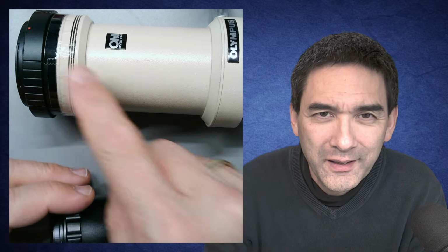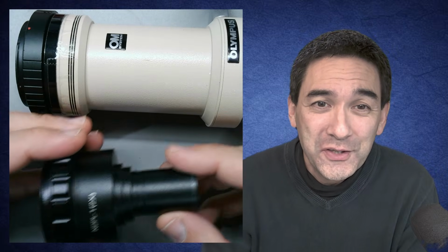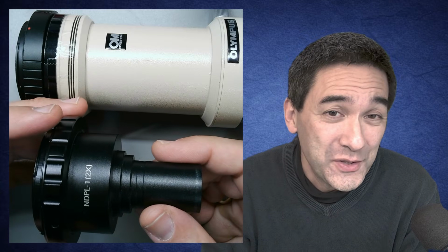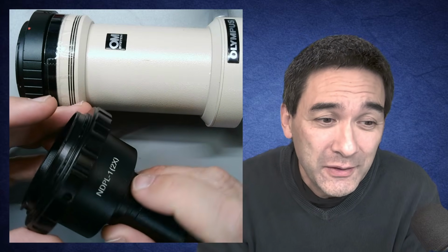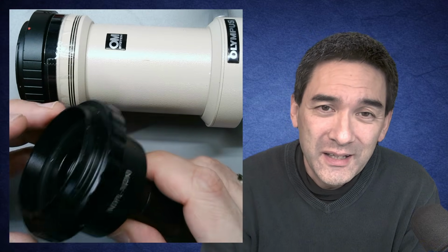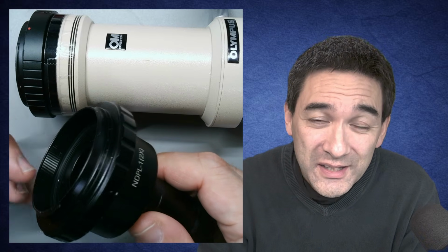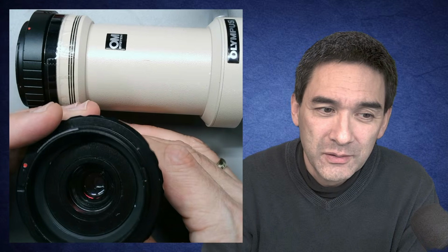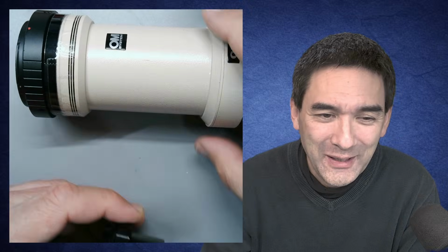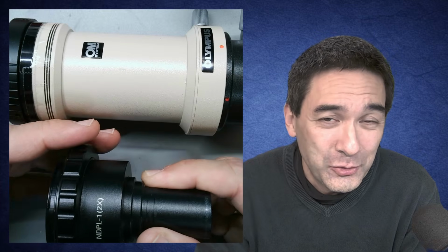Now, if you think that this adapter here is huge, heavy and bulky, then you are right, but there is good news. This one over here is also a DSLR adapter, and of course significantly smaller. Let's have a look at its magnification. Well, what does it say? Not 2.5, but 2. And indeed, this adapter is manufactured for DSLR cameras with a smaller sensor than full format. It's significantly less bulky, but I do have to tell you that the image quality is not quite as good as this one over here. But that is something that you can only find out by trial and error.